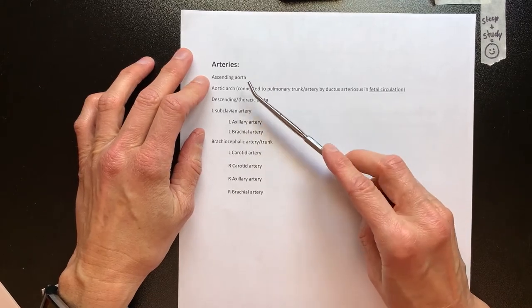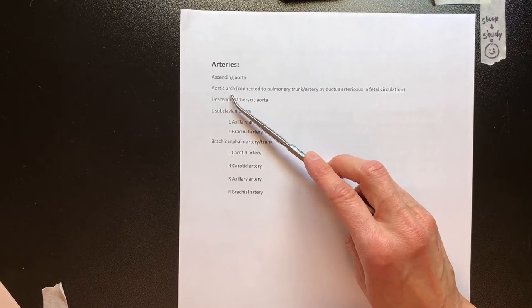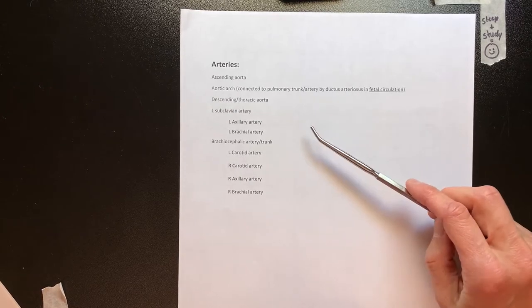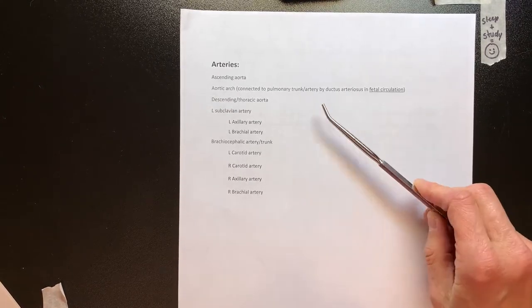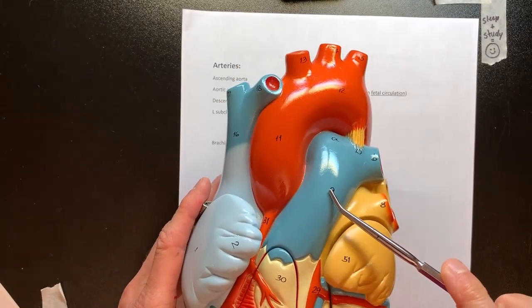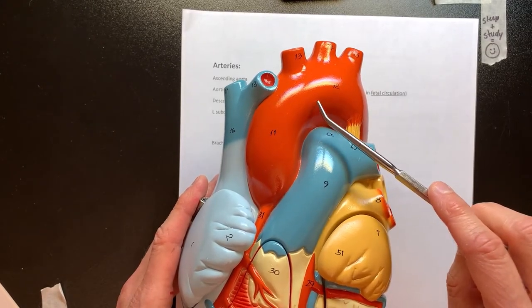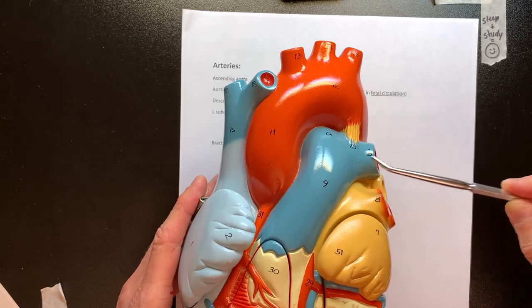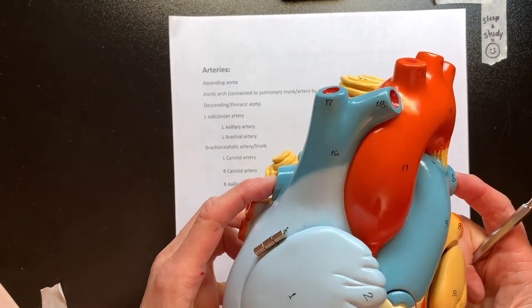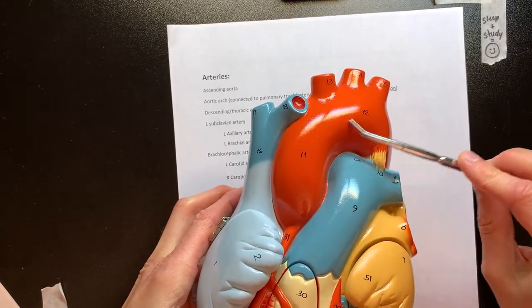We begin with the ascending aorta, which becomes the aortic arch. That's connected to the pulmonary trunk — the most anterior portion of the heart that you can see when you look directly at it, what we call the nose on the heart. In fetal circulation, it's connected by the ductus arteriosus, so when you look at the fetal pig, you'll want to identify this as the aorta, but it's not. Notice that the aorta is behind it. This is the pulmonary trunk, which turns into the left and right pulmonary arteries.